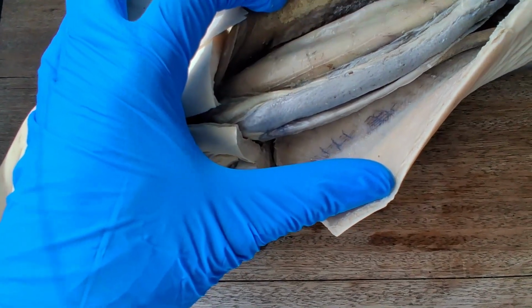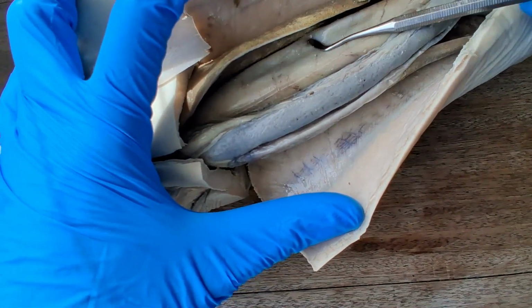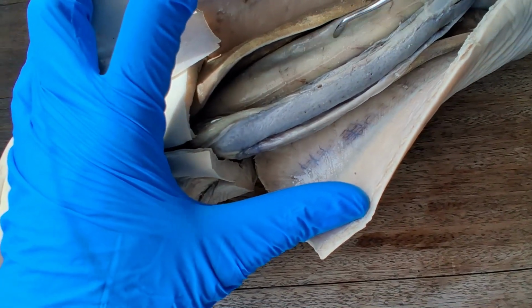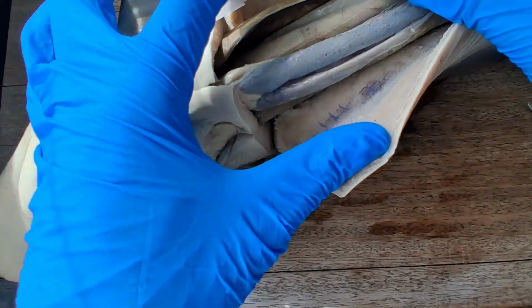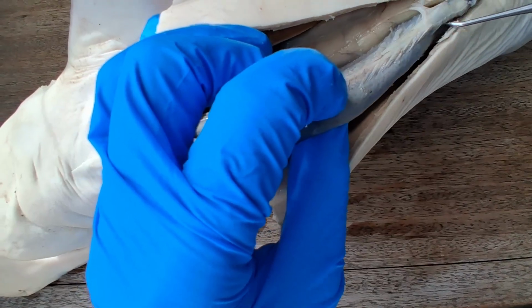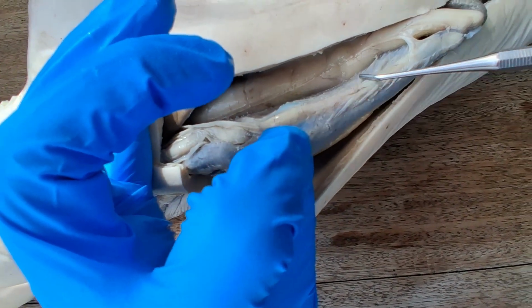That means you have to cut open this. And one feature of the stomach is that it contains longitudinal folds if you open this up, called rugae. Whereas if you open up and see the mucosa of the esophagus, you'll see finger-like projections called papillae. And then pre-digested food will go to the small intestine.